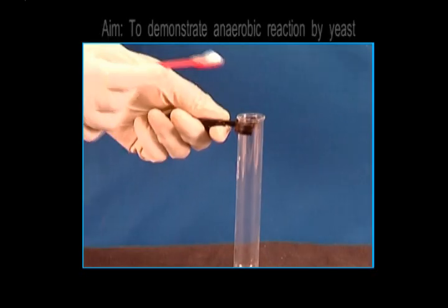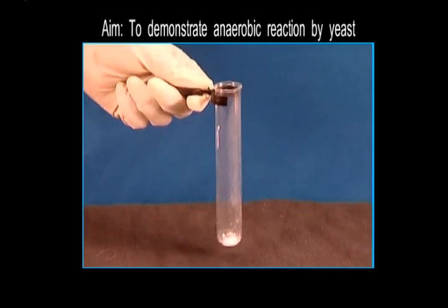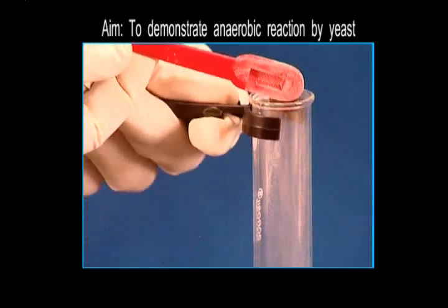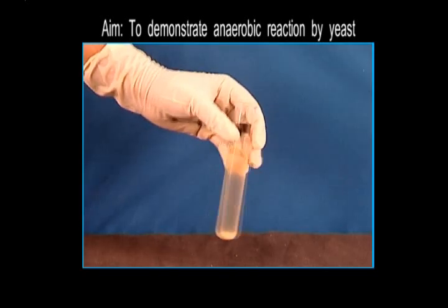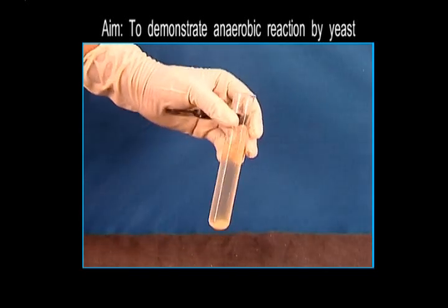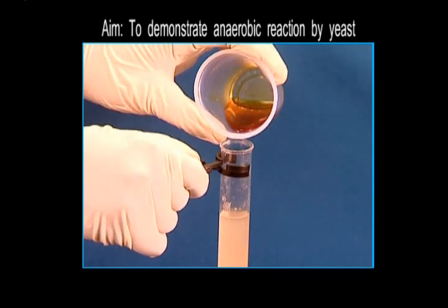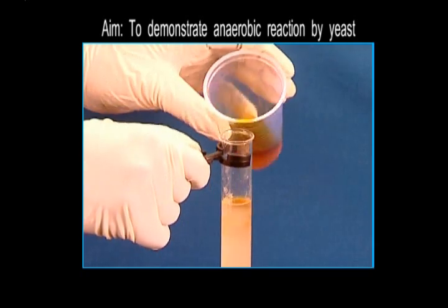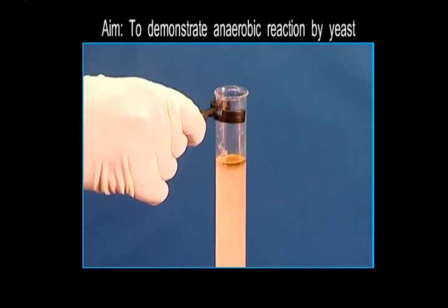To demonstrate anaerobic reaction by yeast, we will first take a test tube and add some glucose, then some yeast. Now we will add water to this and shake well so that the contents get mixed and a solution is ready. We'll now pour some oil into the solution — this will form a thin layer, as you can find here.